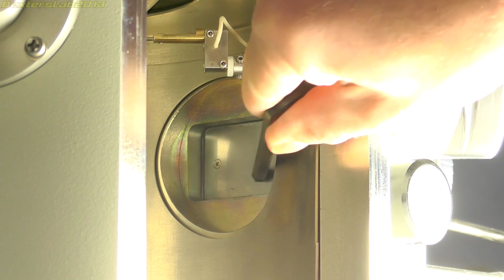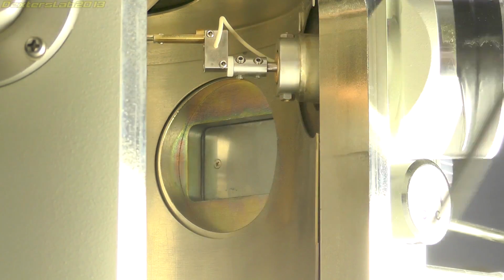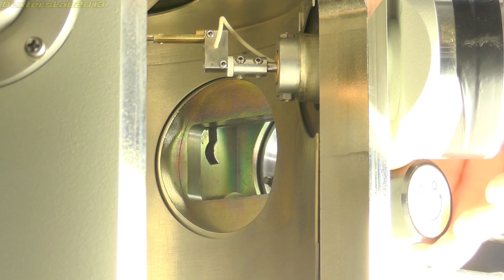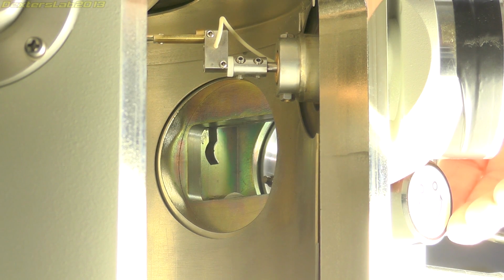This aperture here in the sample chamber is the SEC, which is the sample exchange chamber. This is effectively an airlock. There's a small door here which allows you to open and then gives you access to a secondary vacuum chamber on the outside. I'll show you that in just a moment, to allow you to easily exchange the sample that's inside the chamber without losing all of your vacuum.